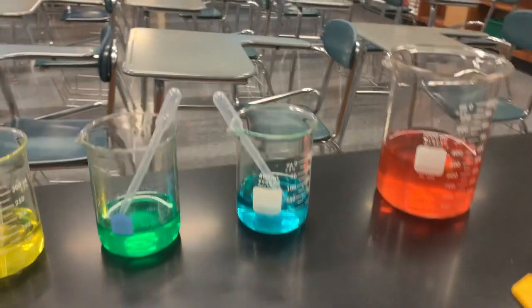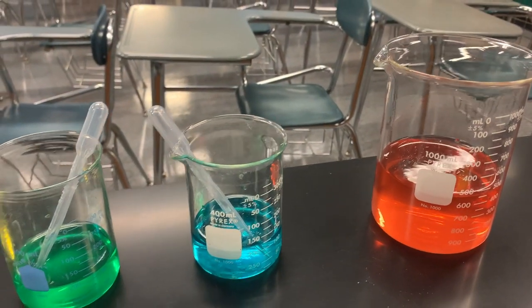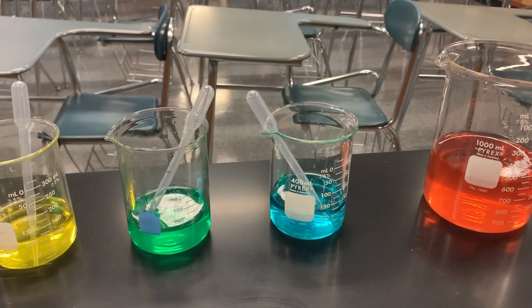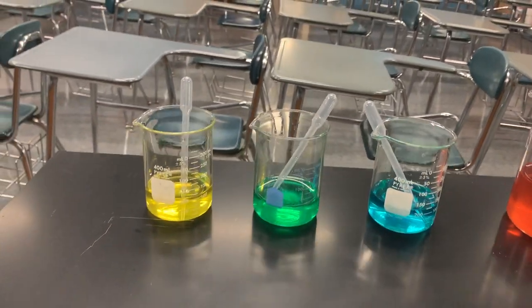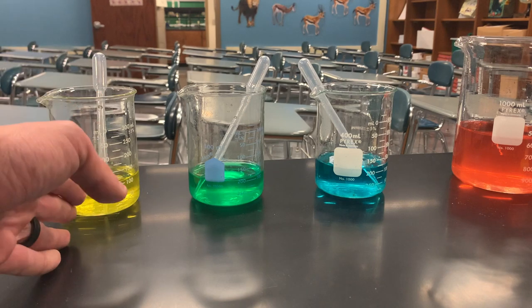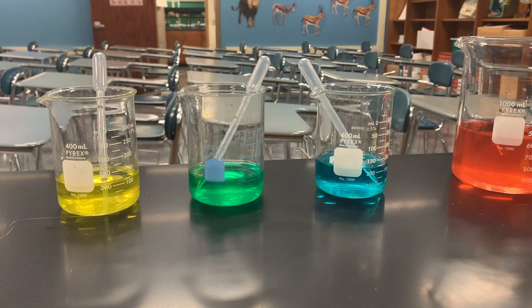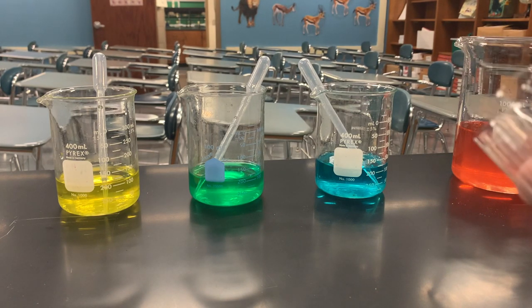I have three different solutions here. We talked about them being sucrose, and then this red one over here is going to be my stock solution. That stock solution is going to have the same concentration of sucrose as one of these three — we don't know which one. That's the goal of the lab: to figure out which one it has the same concentration as — in other words, which one it is isotonic to. We will also find out which one it's hypotonic to and which one it's hypertonic to.